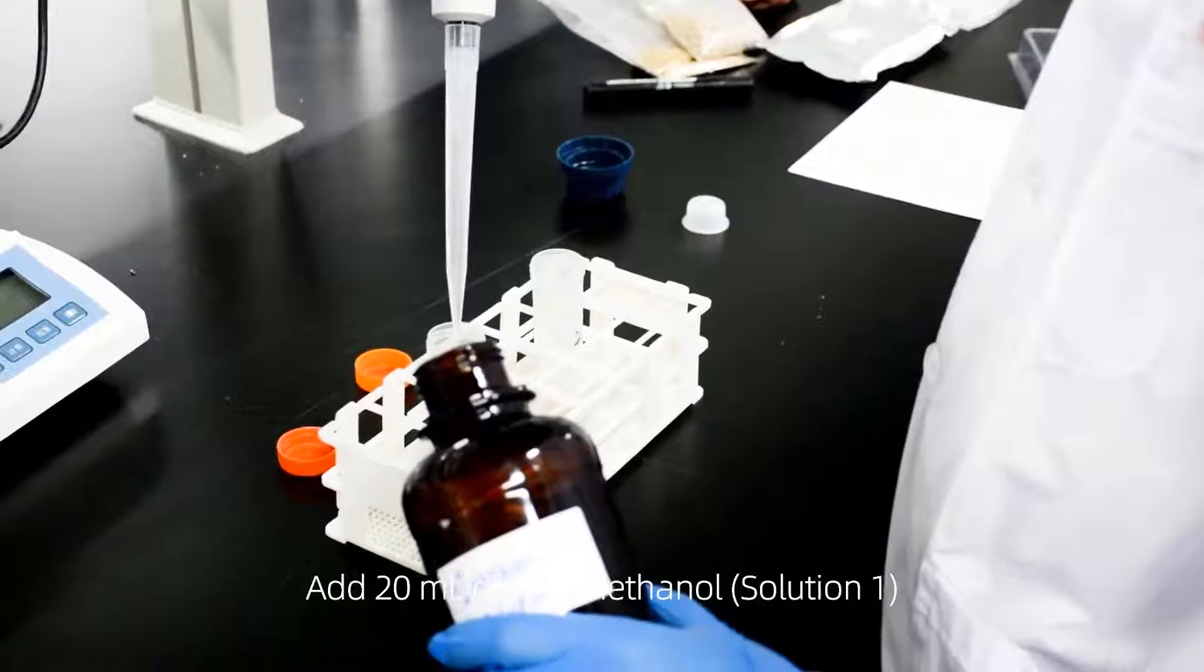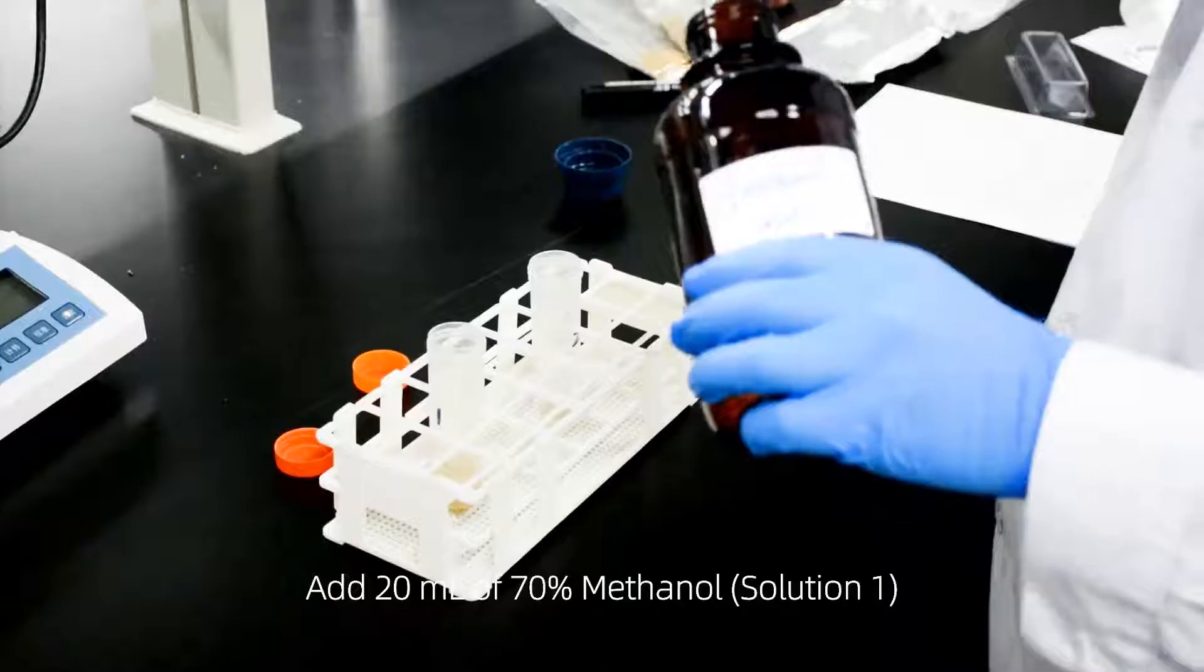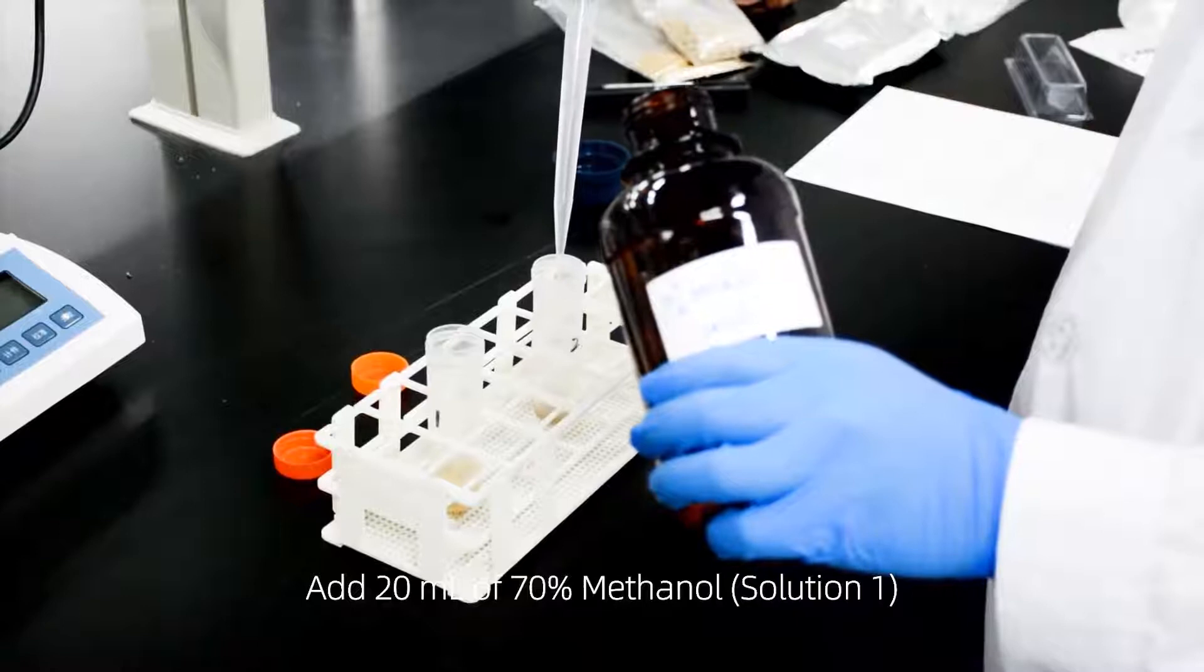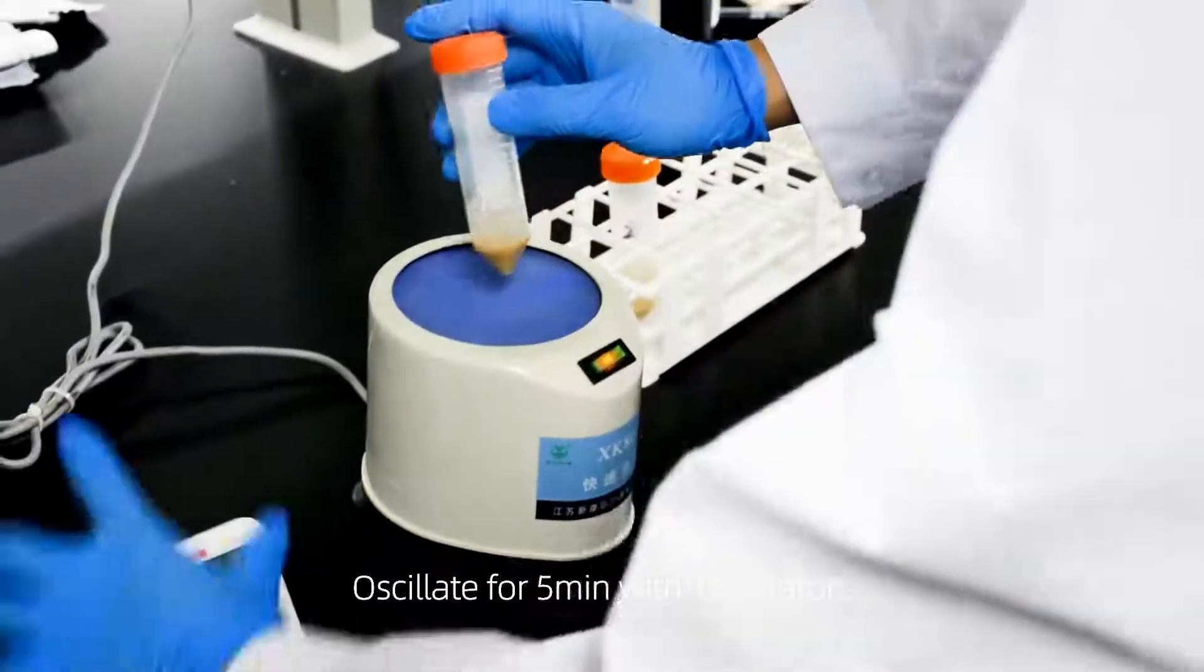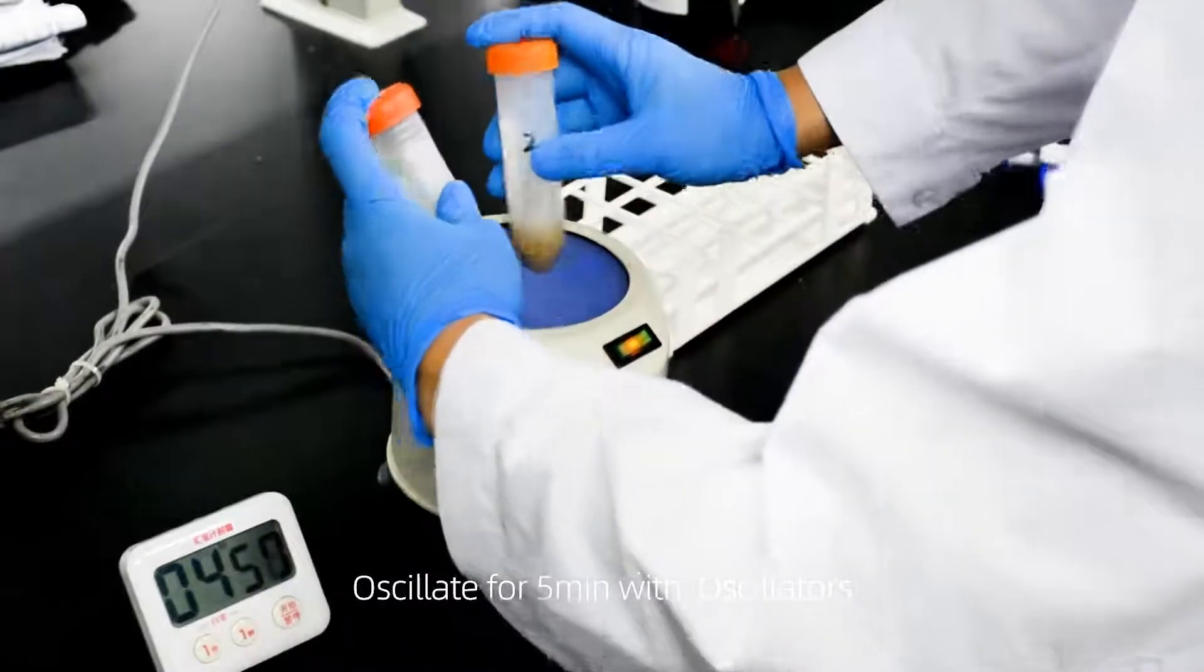Add 20 milliliters of 70% methanol solution. Oscillate for 5 minutes with oscillator.